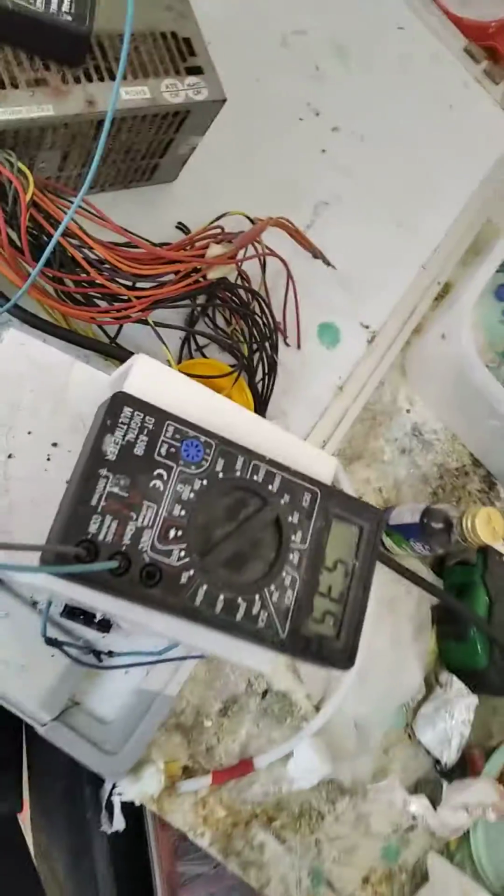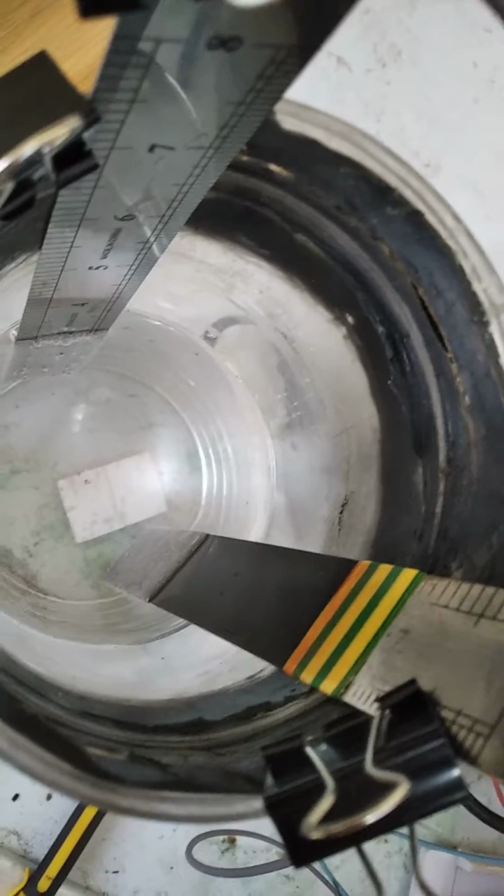This is our new lead dioxide on stainless steel, and it seems to be working in an oxygen evolution environment. This is a solution of sodium perchlorate in water, and it's being given an anodic polarization, and so far there's no sign of any brown tinge that would be otherwise seen in an iron electrode. And of course the cathode is just ordinary stainless steel, and from the top it looks pretty clean.